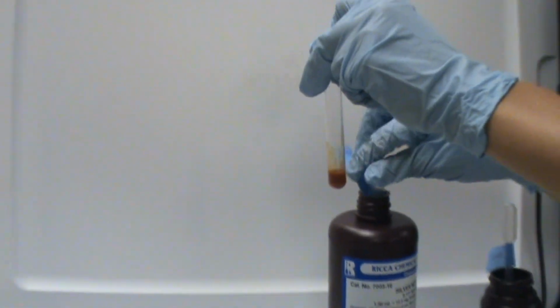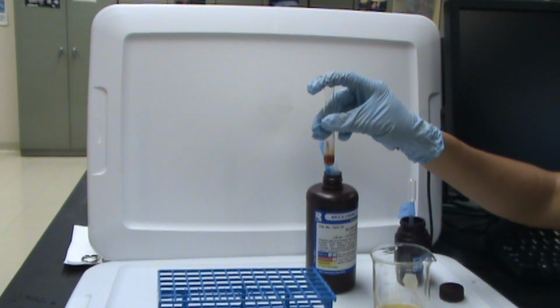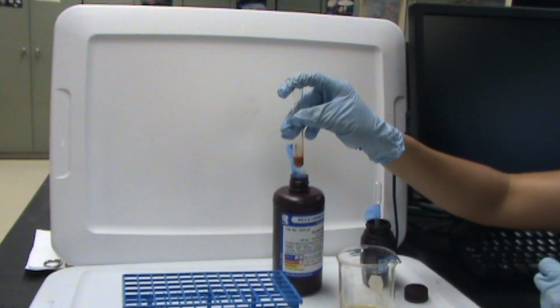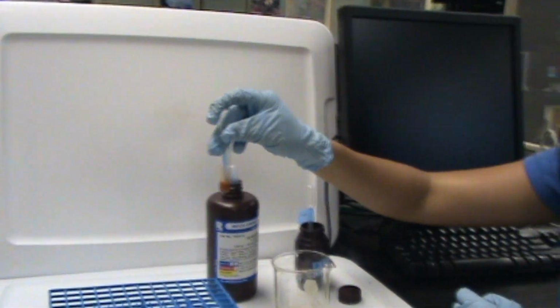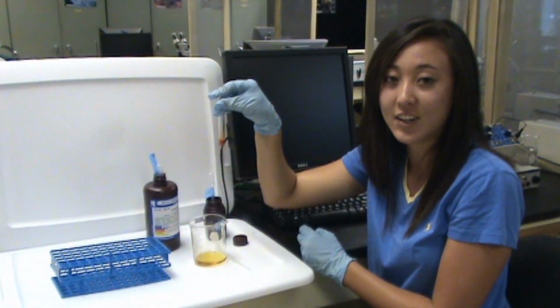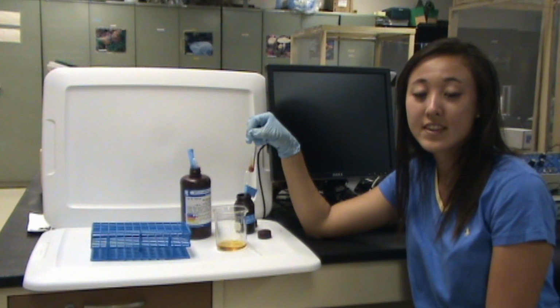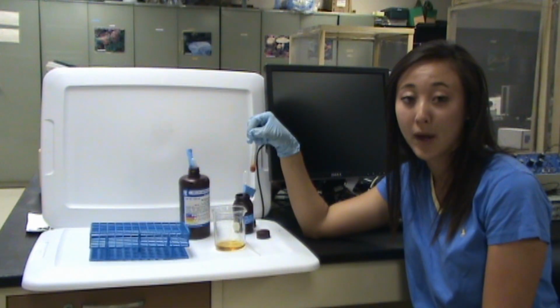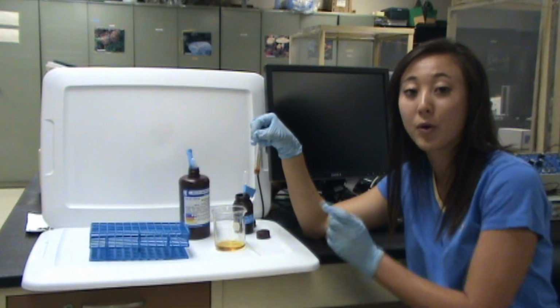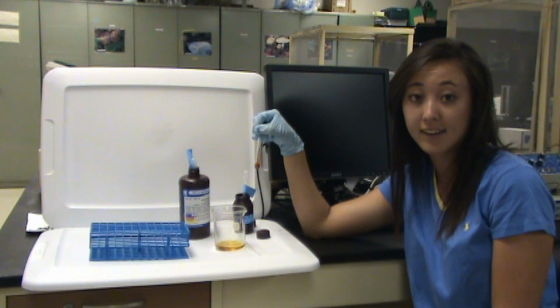Okay, so that was 13 drops. And then what you're going to do is times the number of drops, so 13 in this case, by 0.61 to get the chloride content in milligrams per mil. And that's how you do the chloride content of the urine. So the urine that was tested has to be thrown away properly. So what you're going to do is pour the urine into the hazardous container because it contains the chromate.